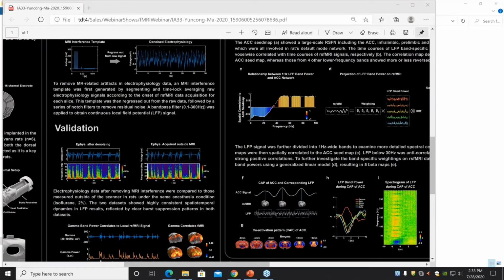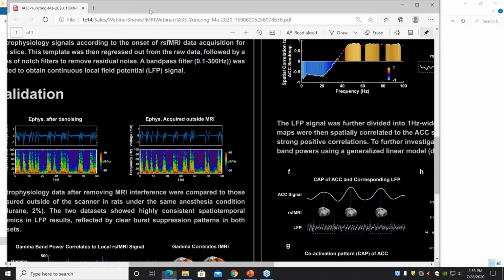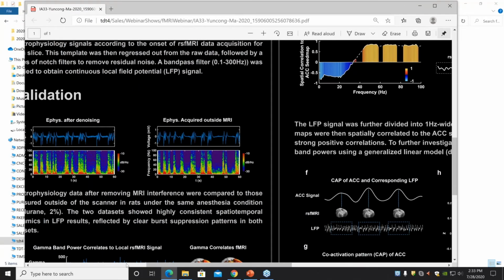So on the left is the data after removing the MRI interference, which you can see has periodic neural activity and intervals with no neural activity. And that shows consistent patterns compared to what we acquired out of the scanner. So we could use this as added validation for our methods. In this way, we can get continuous LFP recordings other than blanking out the MRI acquisition period. So in that way, we could get more information about this neural activation.